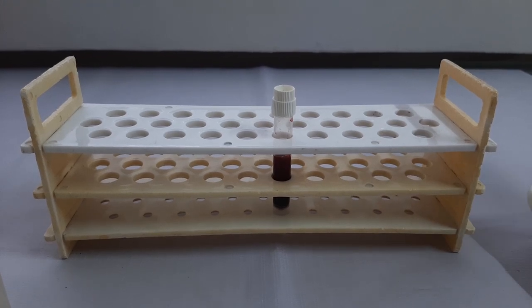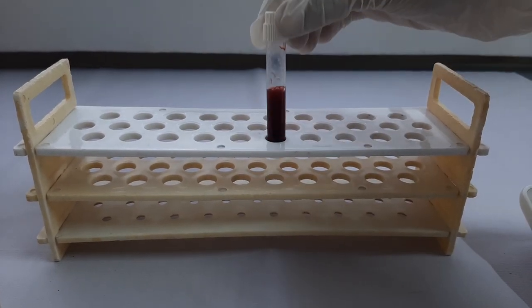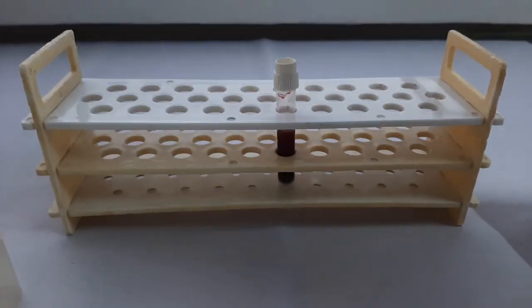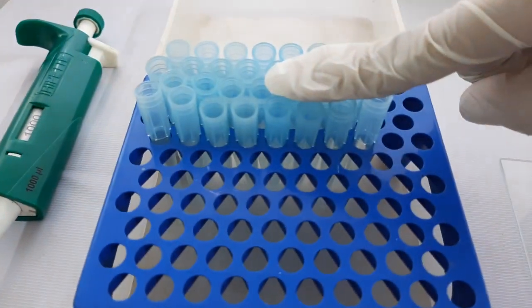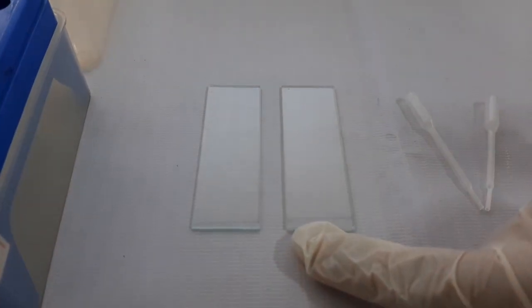Apart from this, you may require additional items such as patient blood sample, clean and dry pipette, clean and dry tips, and clean and dry glass slide.